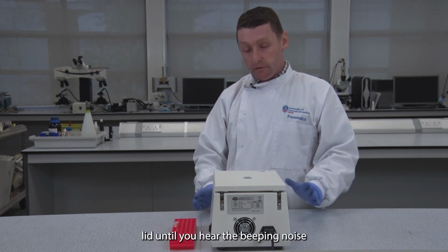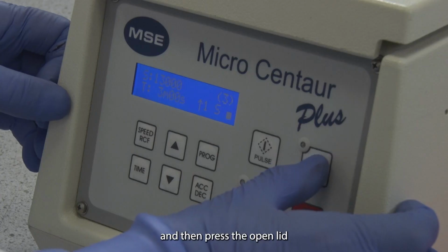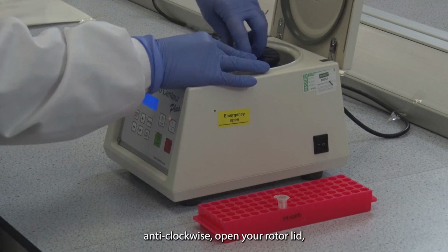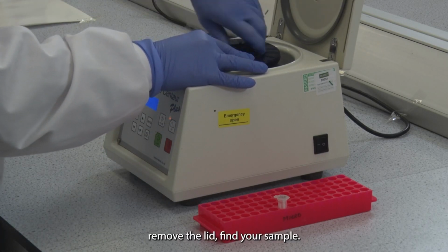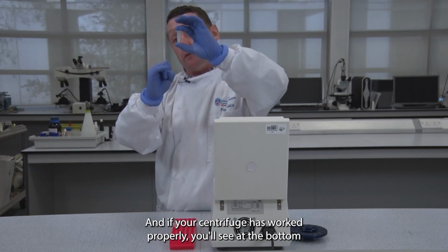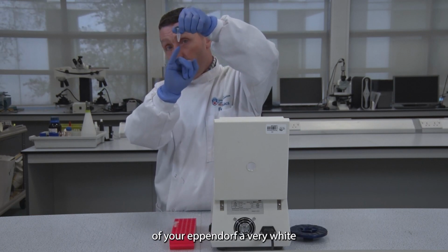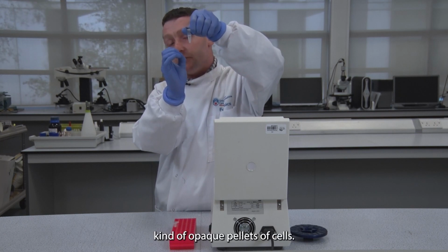Never open the lid until you hear the beeping noise, and then press the open lid, anti-clockwise, and open your rotor lid. Remove the lid, find your sample, and if your centrifuge has worked properly, you will see at the bottom of your Eppendorf a very white, kind of opaque pellet of cells.